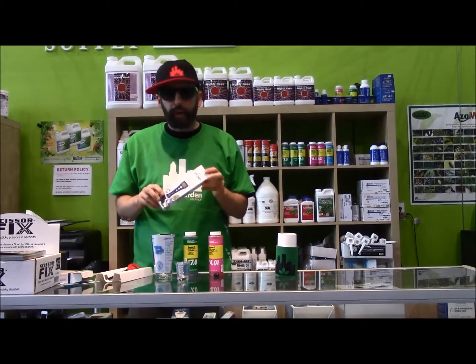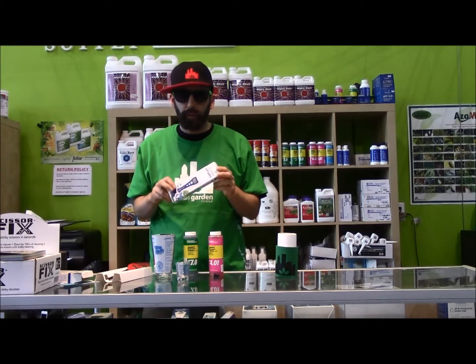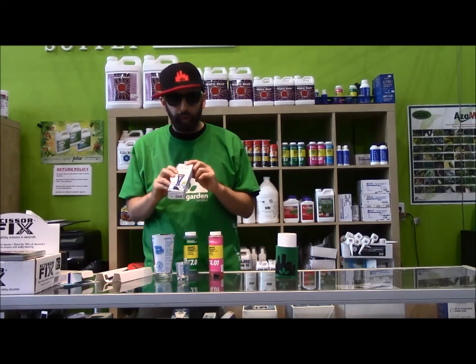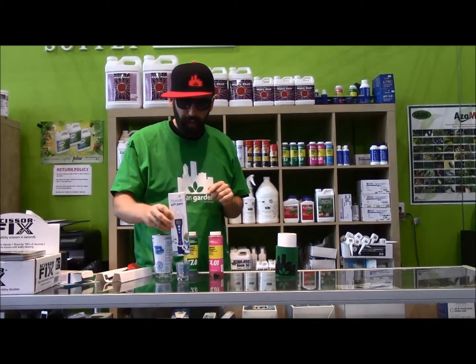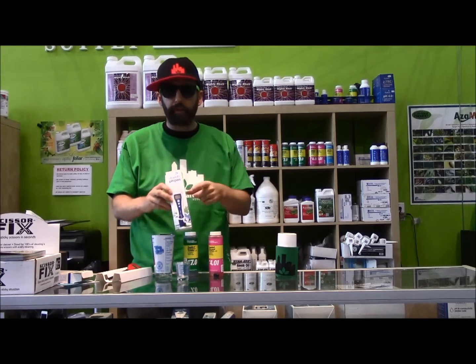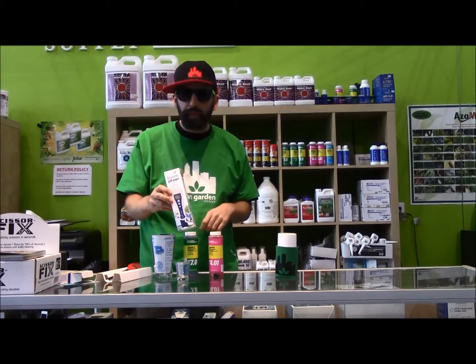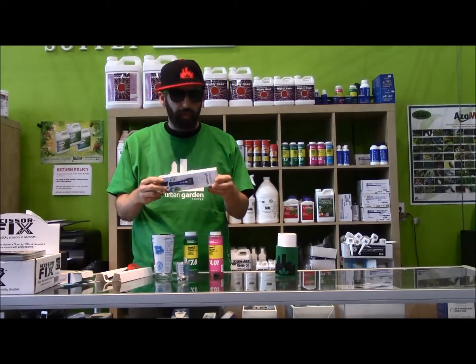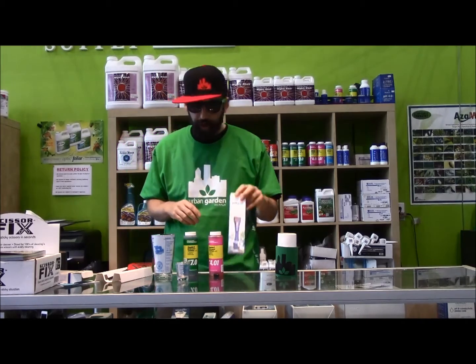Other pens that might cost a little more are typically considerably easier to calibrate. After soaking for 24 hours — I told you it's a magitastical number — you could just dip it into the calibrating solution, hit cal, it'll beep at you, beep number 7, and then you're pretty well calibrated. Of course, I've been wrong before, so make sure to follow the directions on any of these.